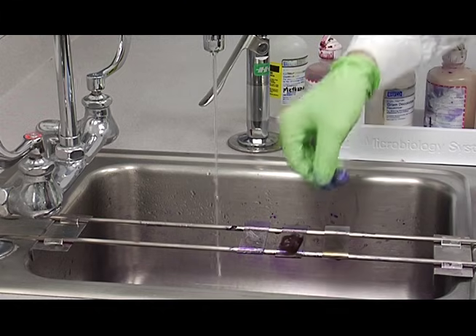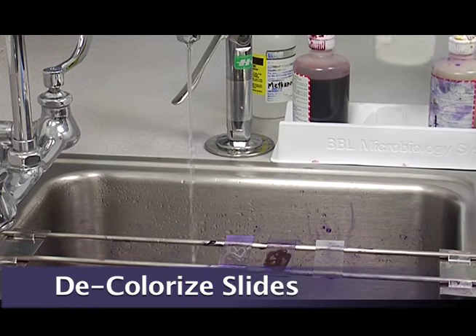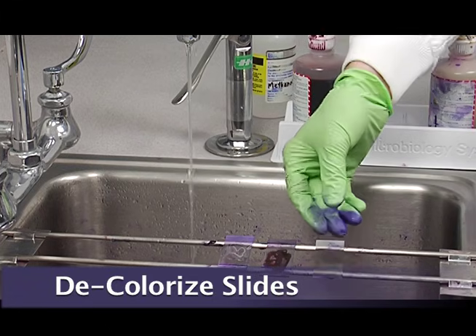And now we're going to decolorize. Decolorization is the most critical step.